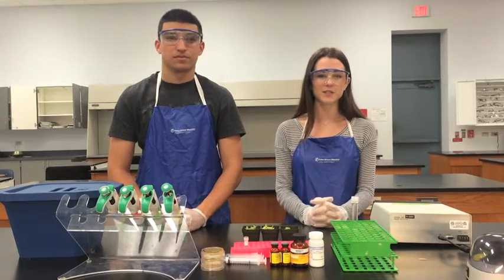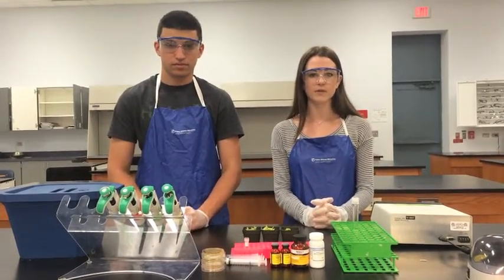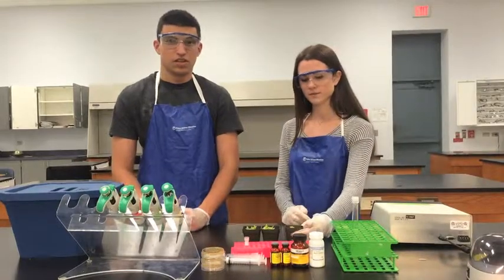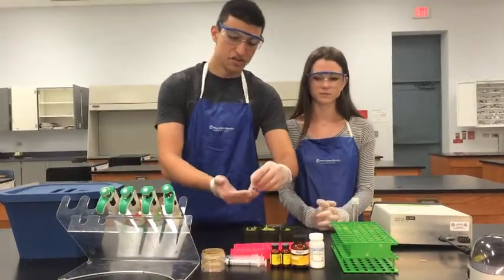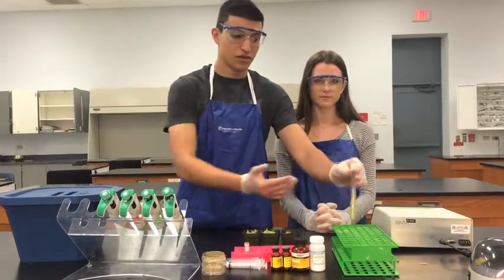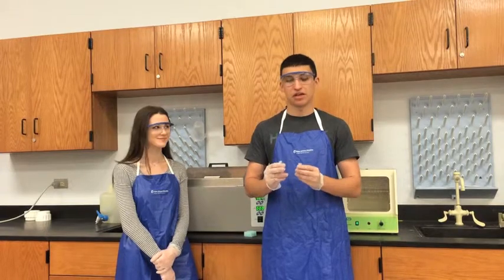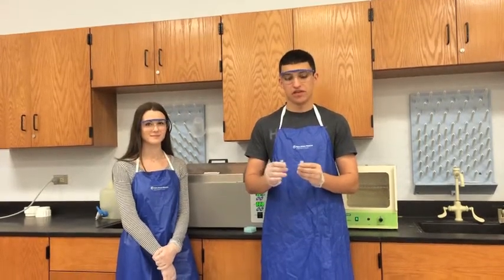The biofortification process begins with the transformation of agrobacteria. For this demo, we will be fortifying Arabidopsis with lysine. Here we have a plasmid that contains the gene for lysine production, and here we have the wild-type bacteria. All of the bacteria and the plasmid containing the lysine production gene are then combined into these two tubes. One's a positive and the other one is a negative control.